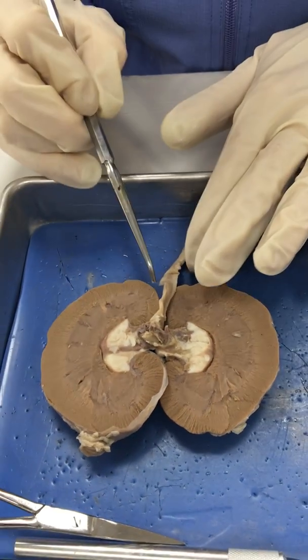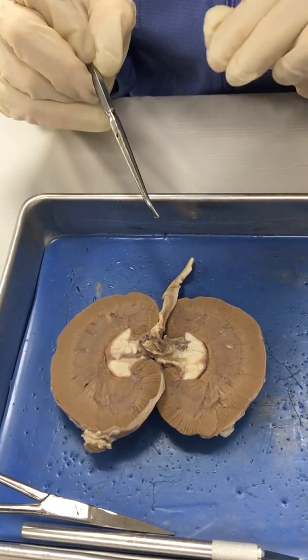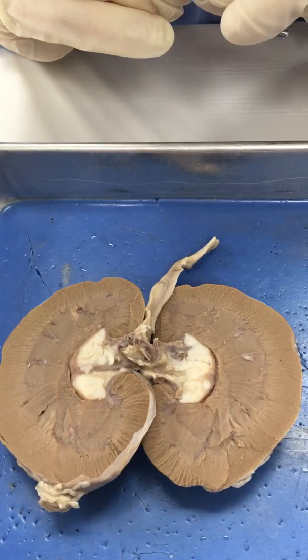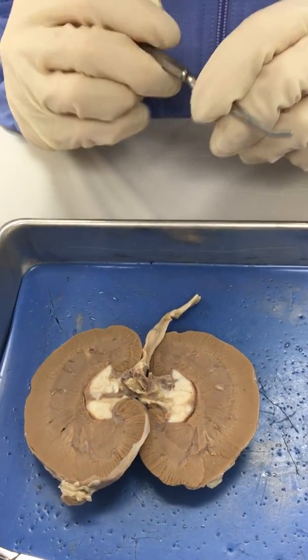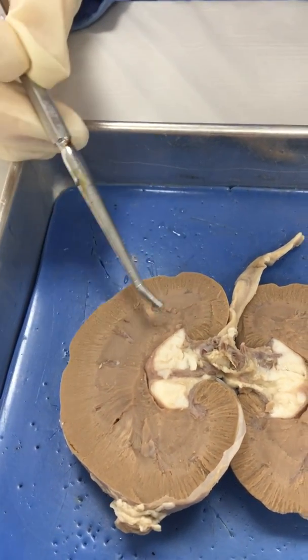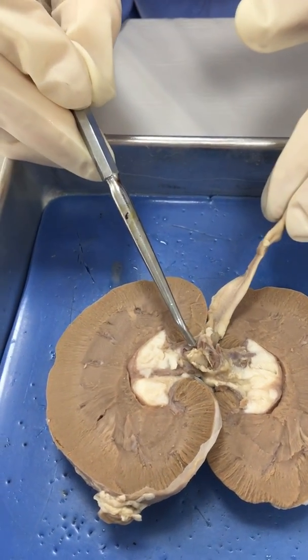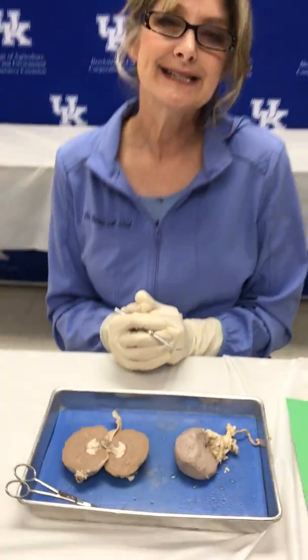So again, the main function of the kidney is to filter out the blood and to produce urine and waste products to get rid of through the excretory system. These are the main areas of the kidney: the cortex, medulla, and renal pelvis, and then in the hilar region we have arteries, veins, and the ureter to collect the urine. This has been a basic dissection of the kidney in the sheep.